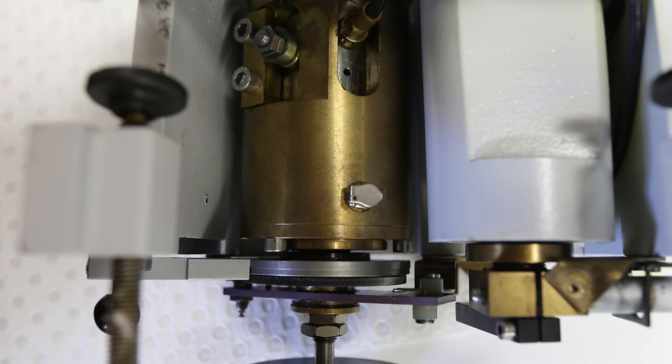I notice that there's what appears to be a valve on the outside of the brass cylinder. So perhaps the cylinder needs to be pressurized somehow, is the only thing that I can think of. And over time, it just loses pressure in the same way that a car tire does, and you need to top it up every now and then. And perhaps that's why the one that was stored in the box also had the same problem.